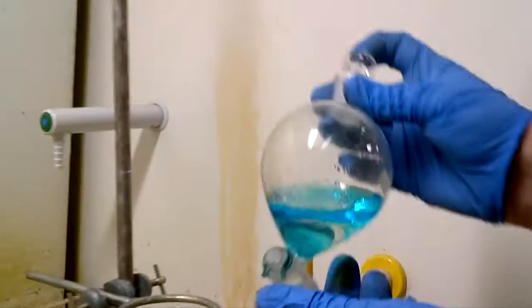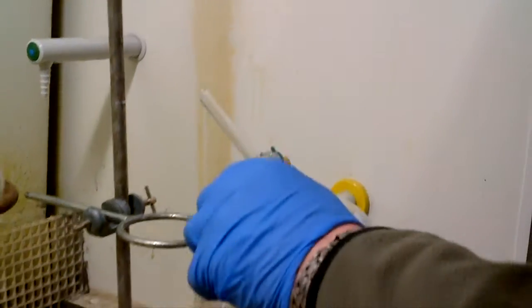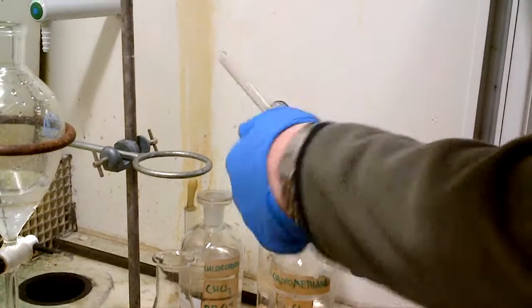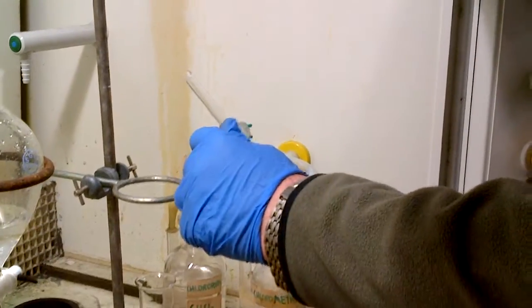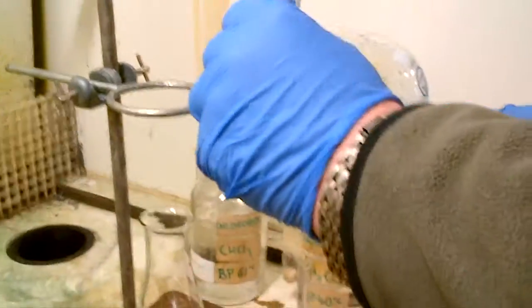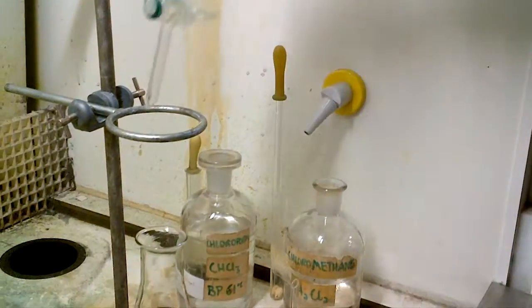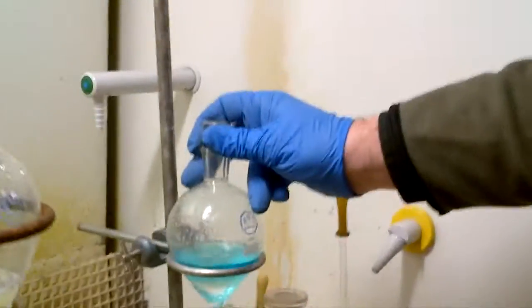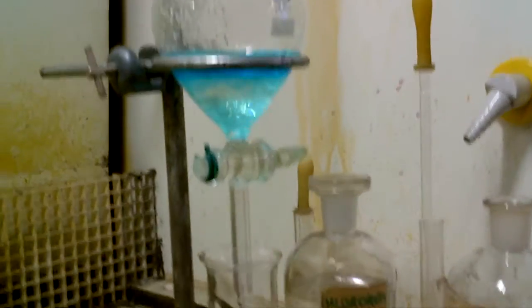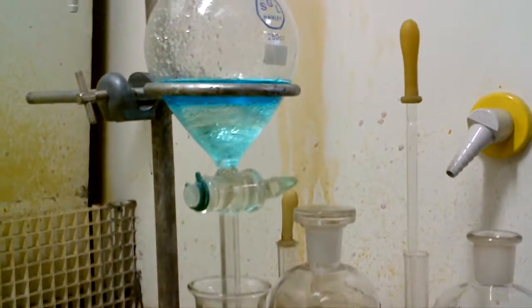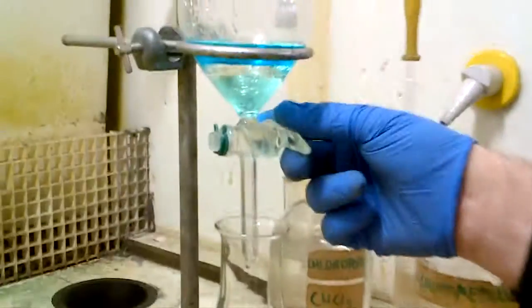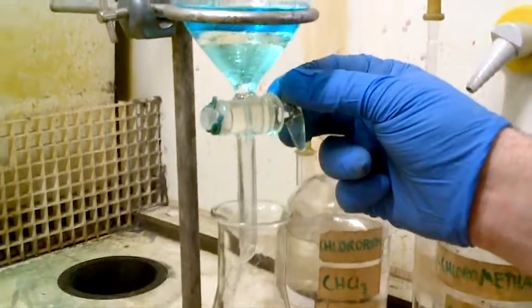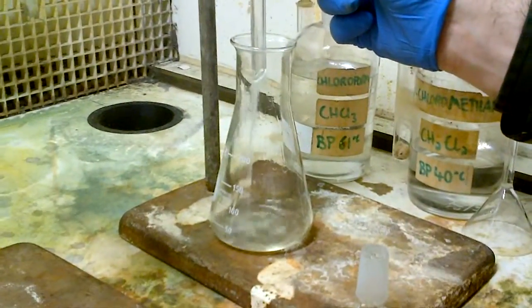And now swirl one, two, three away from your face and anyone else's, vent, one, two, three, vent, let it settle down. We need to keep the bottom layer now, which is the organic layer, and this obviously can be rinsed into like the conical flask, or sorry, or the, yes the conical flask, so now it's just settling down, so we can run down DCM.